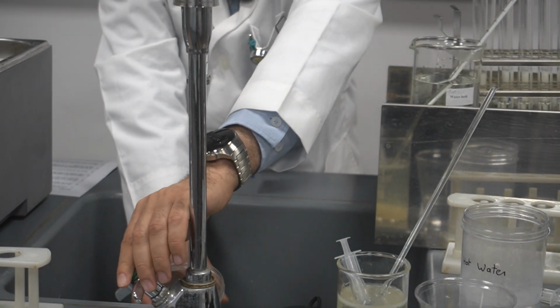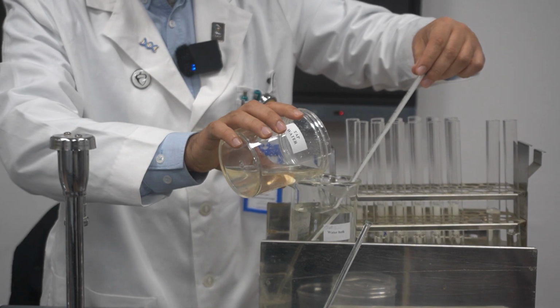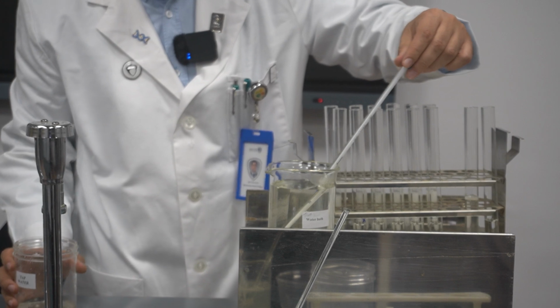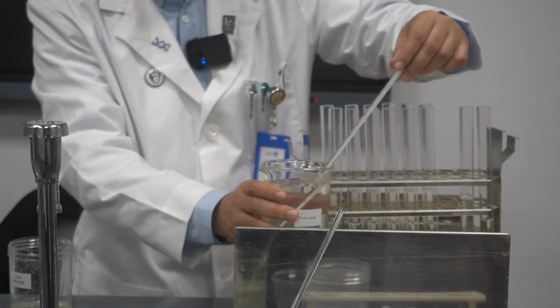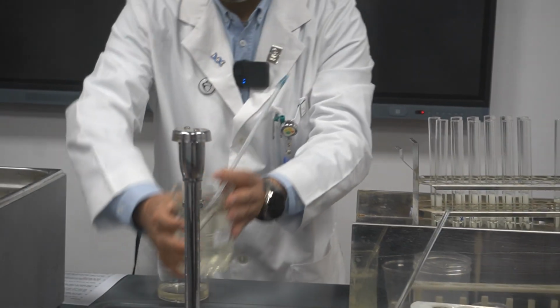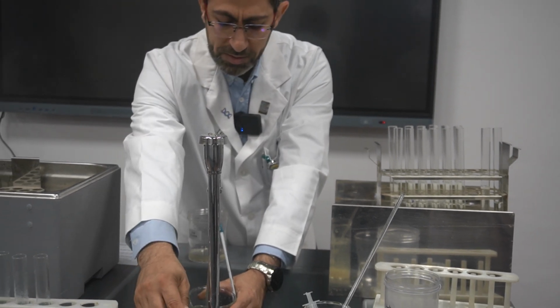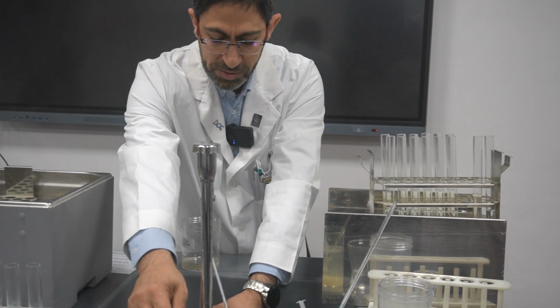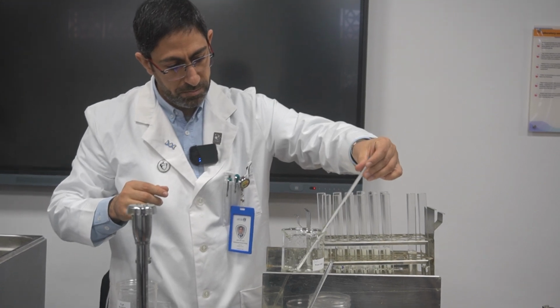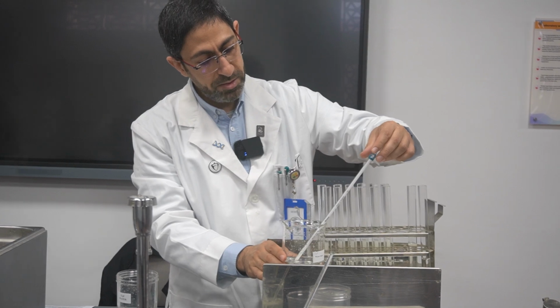I will use the time in order to present this as a demonstration. Afterward, each one of you can do this in groups. Now, because I started at 100, I'll throw all of it out and just take tap water, which is by default at room temperature, and I will measure it as well. Yes, it dropped. Now it is 20.